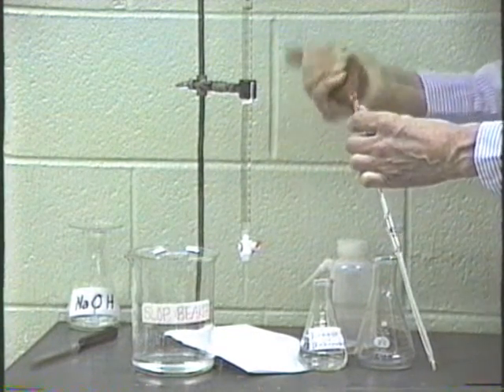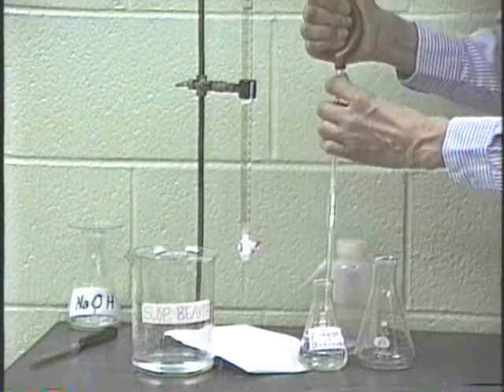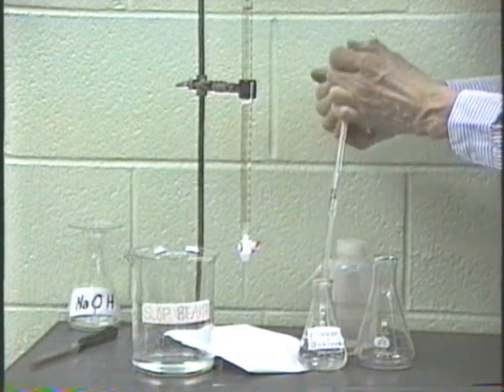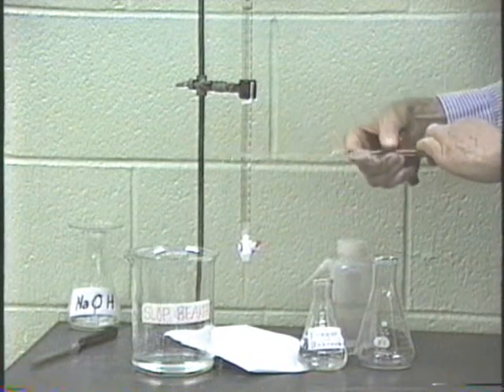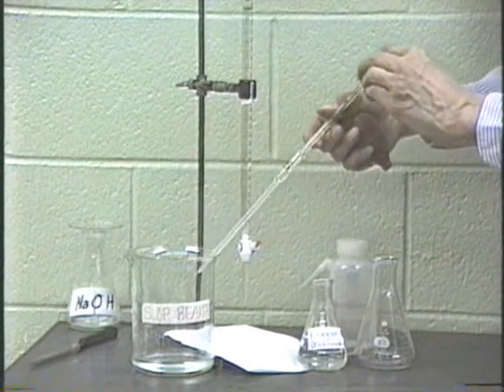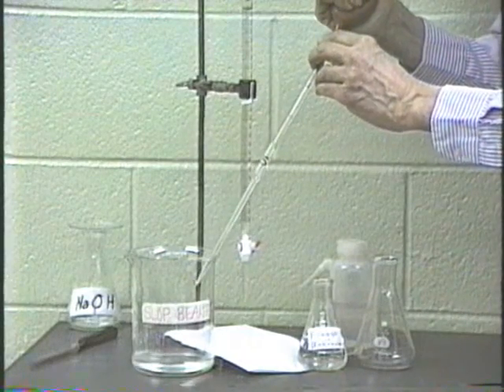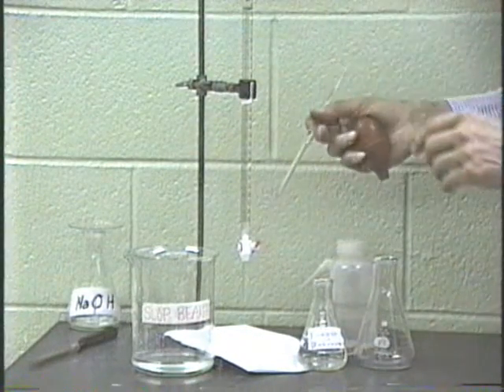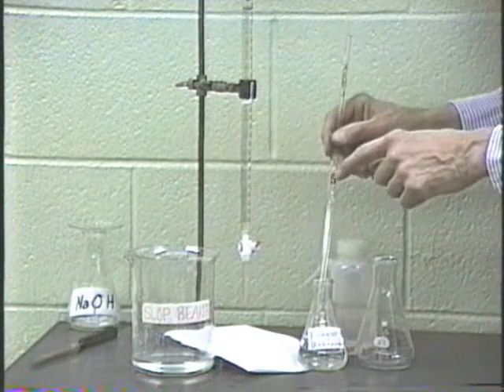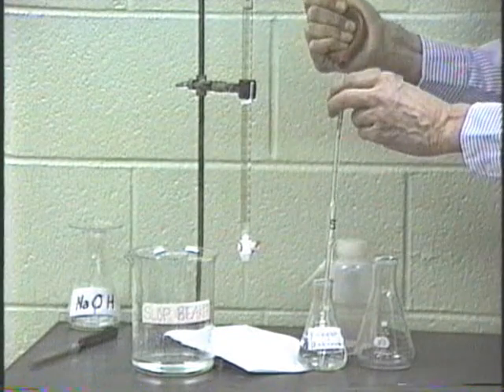So it just is there and you can quickly take it off. Squeeze it, put it on, and now dip the tip of the pipette well below the liquid level. Take up a few milliliters of solution, and just as you did with the burette, rinse it out. We can use the rubber bulb to blow out at this point because we're not interested in exact volumes, we're just rinsing. Once it is rinsed out, then again, we will fill up the pipette.